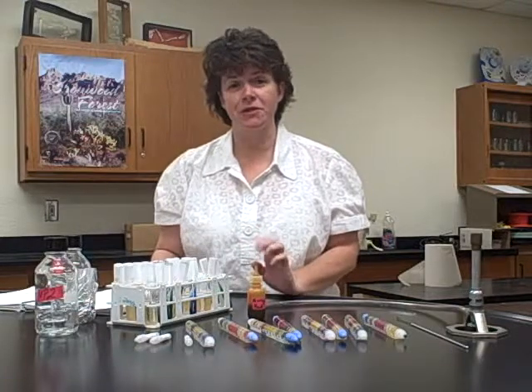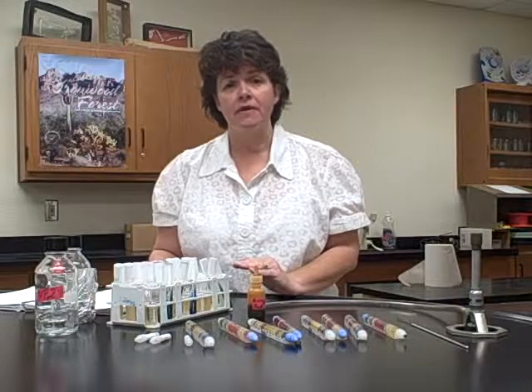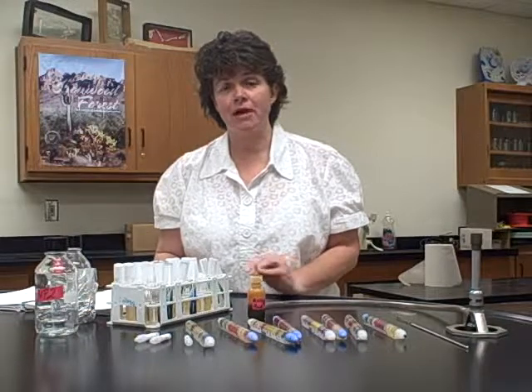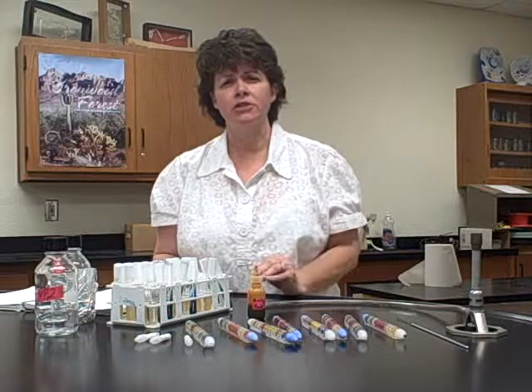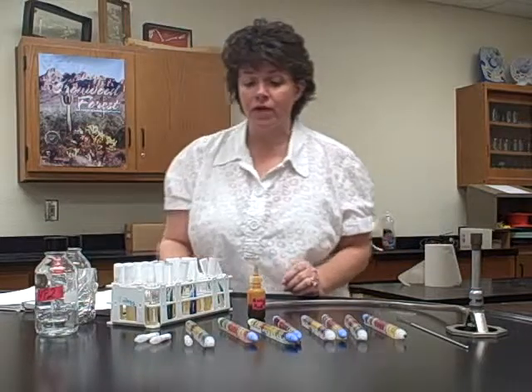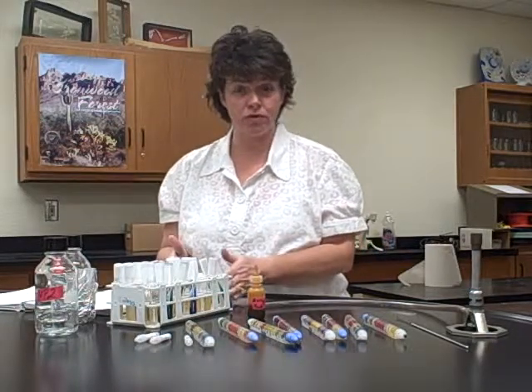With all of these, you also do it on an empty, uninoculated tube, so that you can compare the results. If you recall, back when we did fermentation of carbs, especially with the VP test, it's hard to tell the actual result because it's just kind of a pinkish hue rather than being completely red. So there'll be uninoculated tubes for you to do a control, okay?